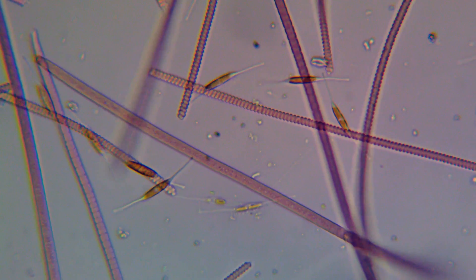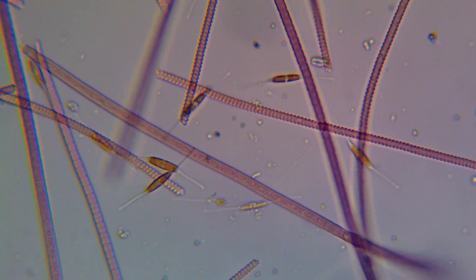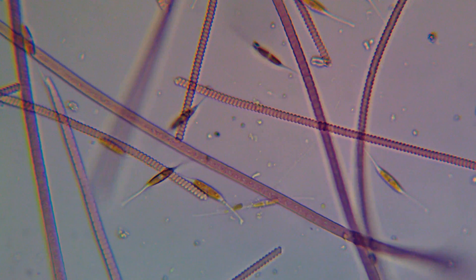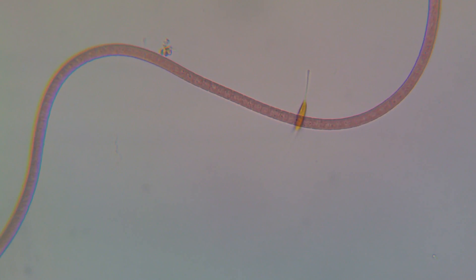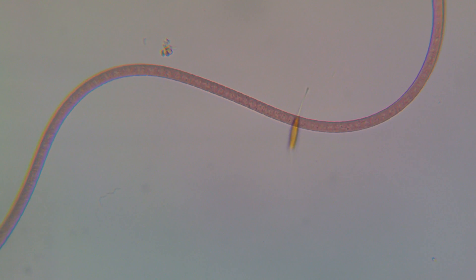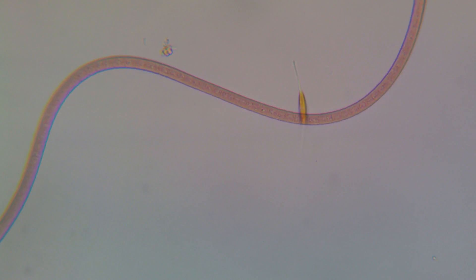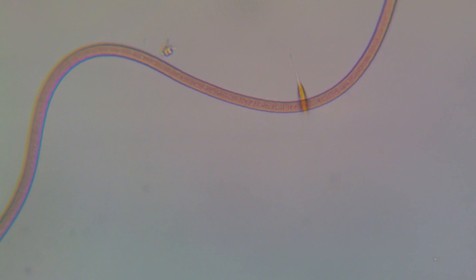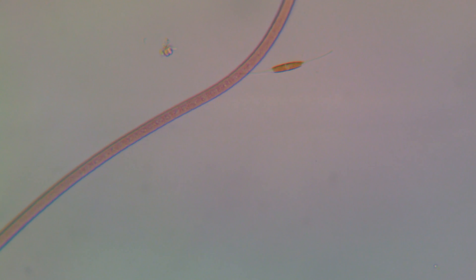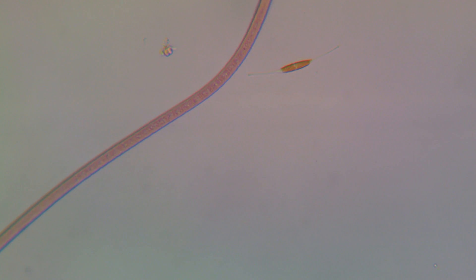So what's different about this time? Well, last time I just saw a lot of spirulina. Now I'm seeing both spirulina and a lot of just normal, regular cyanobacteria. You can tell the difference between the two because spirulina is a spiral, where the normal cyanobacteria looks just like segments. And you can see that here in the videos.